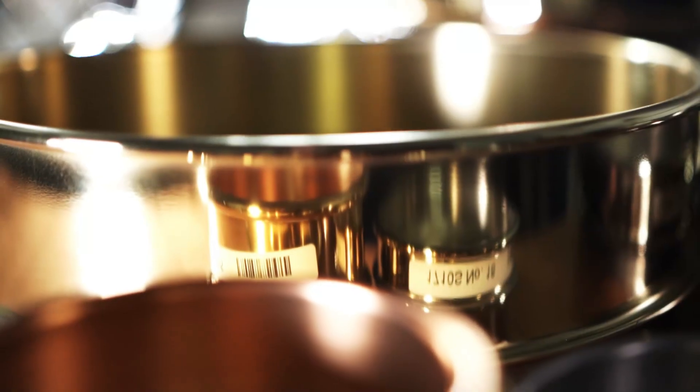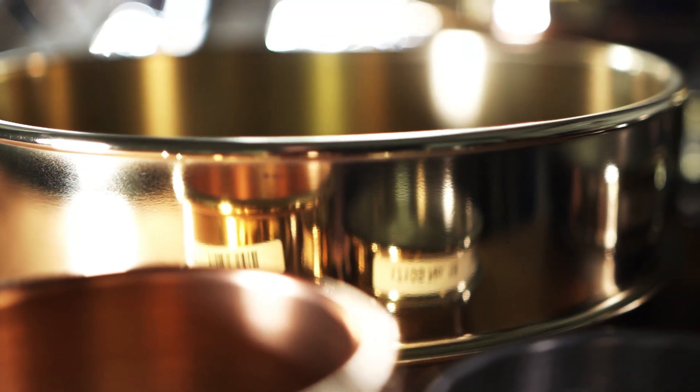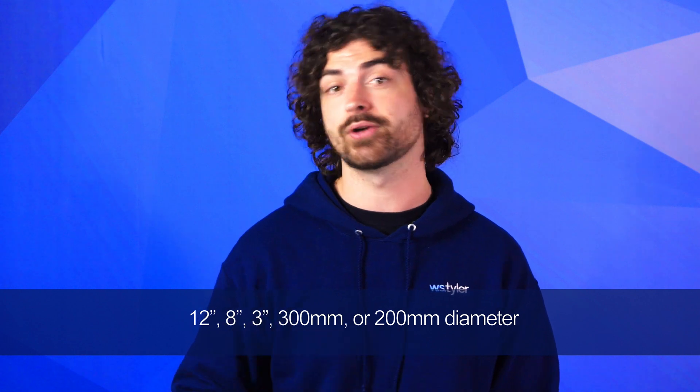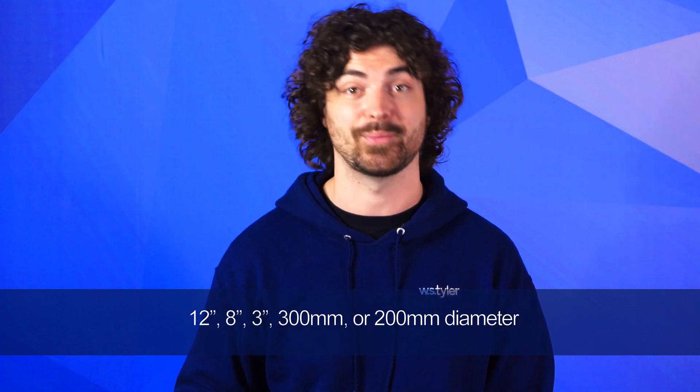The term sieve size can be used to describe two aspects of a test sieve: the diameter of the sieve frame, and sometimes the mesh count. For this purpose, we'll refer to the diameter of the test sieve. Typically, sieves have either a 12-inch, 8-inch, 3-inch, 300-millimeter, or 200-millimeter diameter.